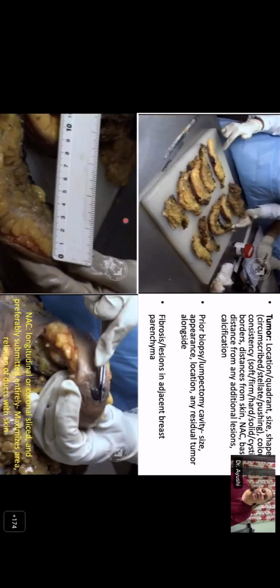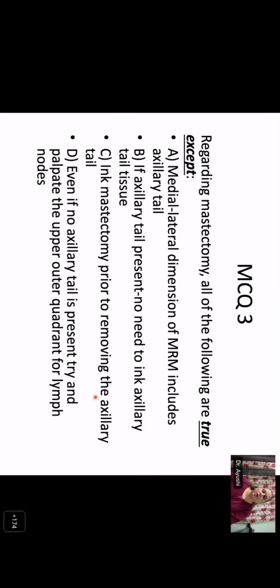Once the specimen is fixed, we can extend our cuts to the full thickness and arrange it again in a sequential manner, so that we can identify the tumor and the slice it is involving. Again, measure the distance and location of the tumor and the size of the tumor with the distance from the base, skin, and the areolar complex. And because mastectomy is generally done if the tumor is multifocal, we should also try to identify any other lesions present in the breast. The section from the nipple areolar complex is by convention usually taken in a longitudinal or coronal slice to submit the maximum area of the skin with the underlying ducts.